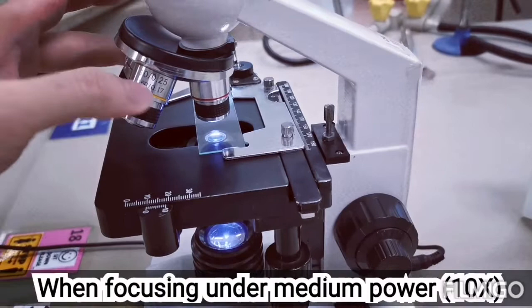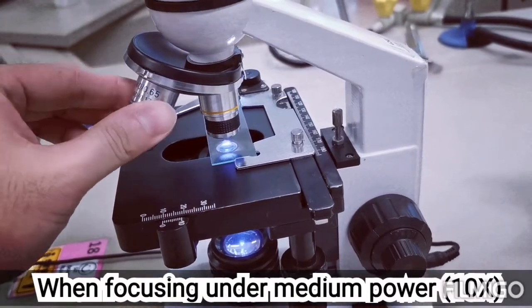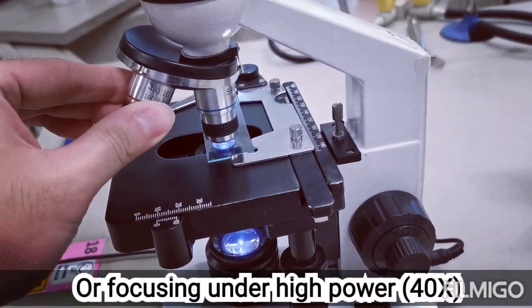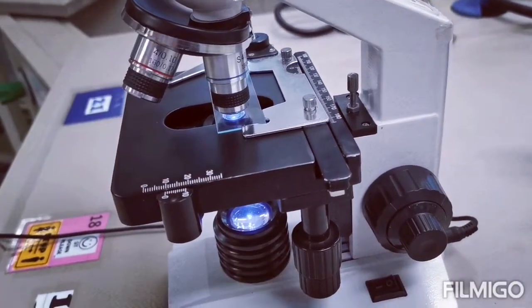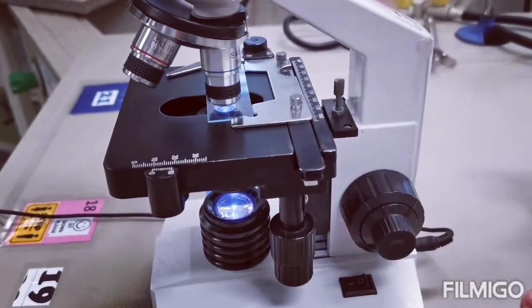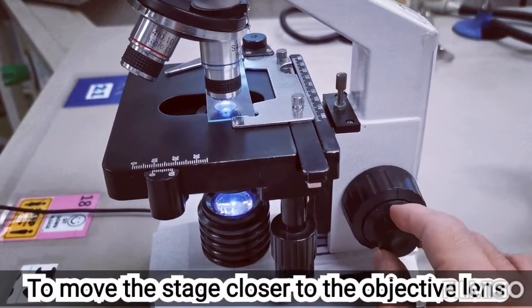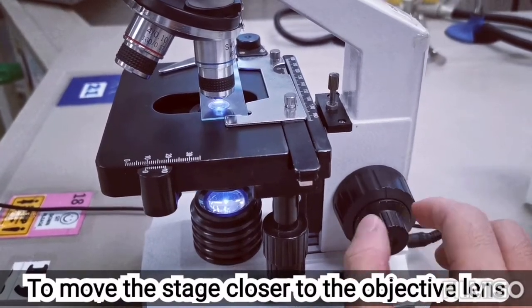When focusing under medium power, the 10 times objective lens, or under high power, the 40 times objective lens, the stage is already very close to the objective lens. Hence, we will use the fine adjustment knob, or the smaller knob, in order to move the stage closer or further away from the objective lens.